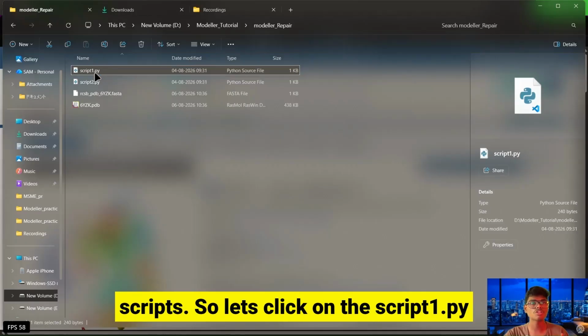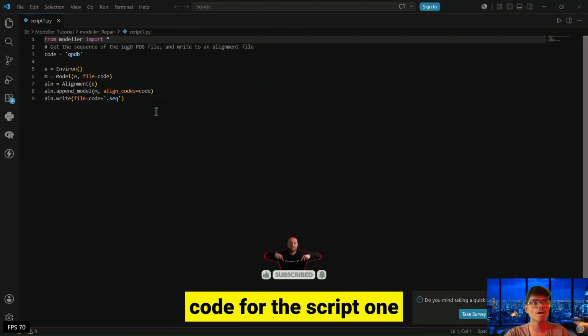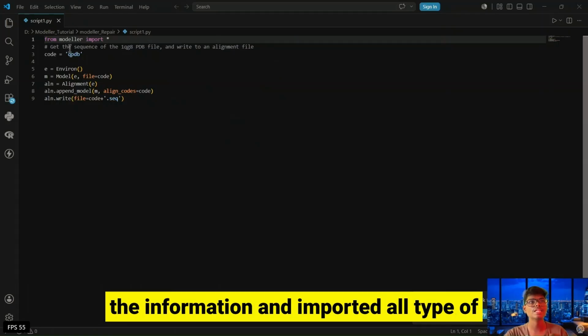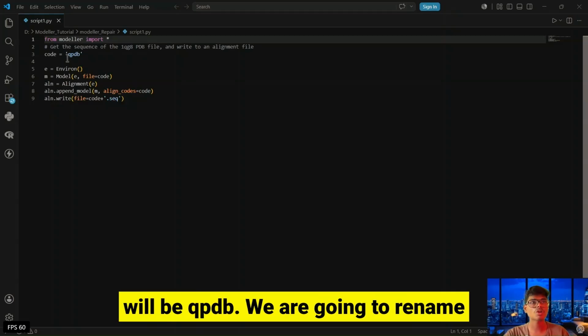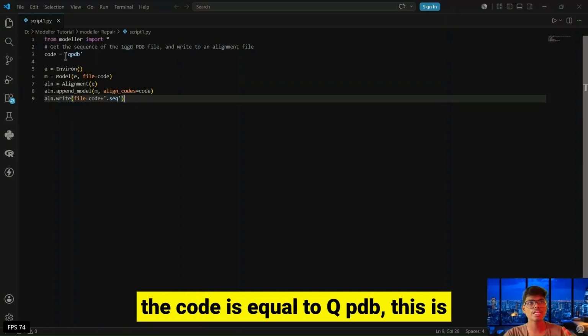So let's click on script1.py, and here you will find the code for script1. It uses the Modeller application to get the information and imports all the libraries using Modeller. So the code will be qpdb. We are going to rename the file. As we know, the code is equal to qpdb, this is the file name.